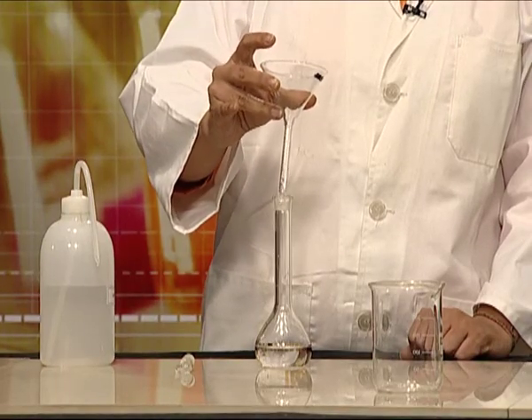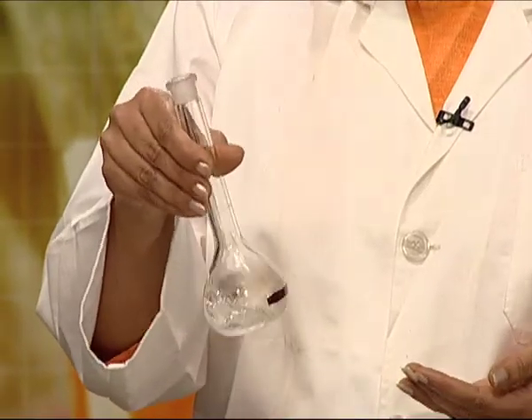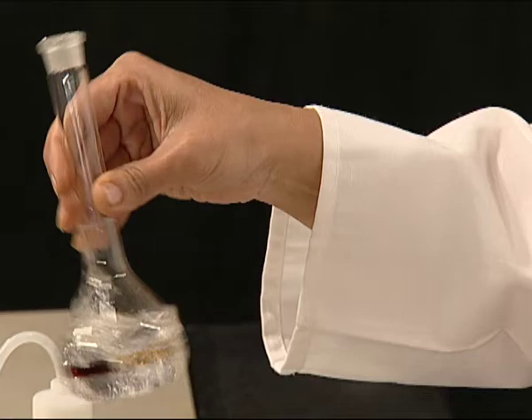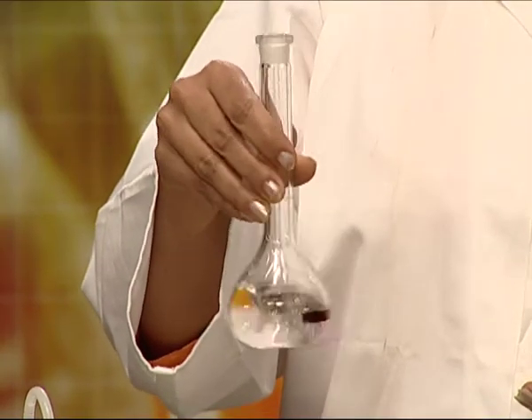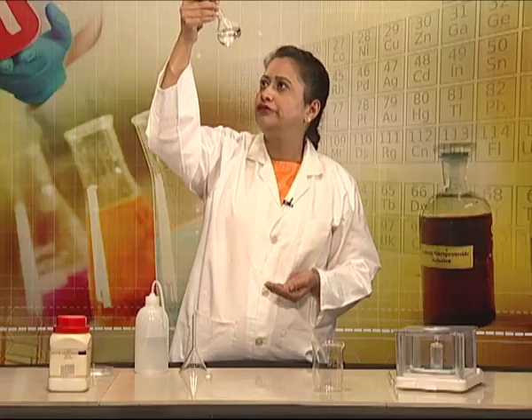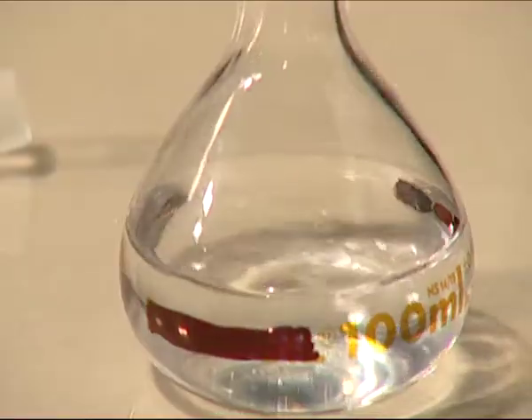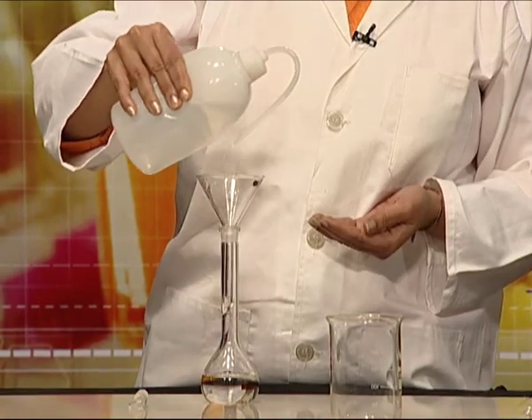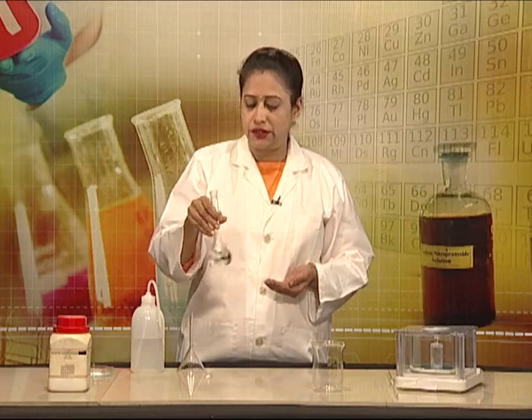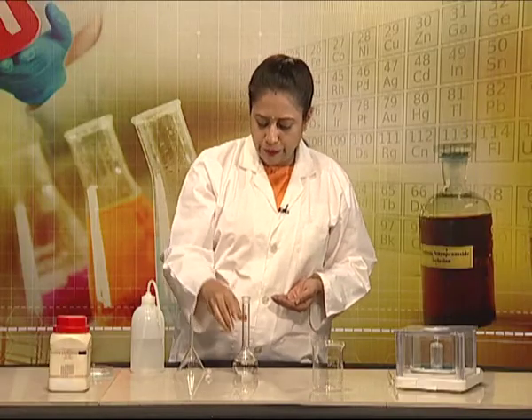We will not make the volume complete at this point. We first need to shake the flask well. As we can see, the salt has dissolved, and then we can make up the volume to the mark.